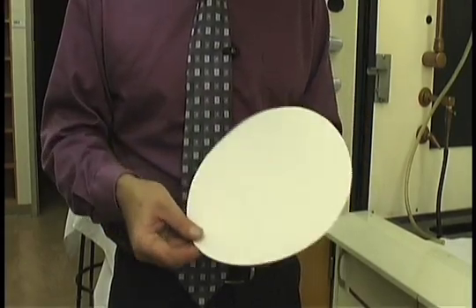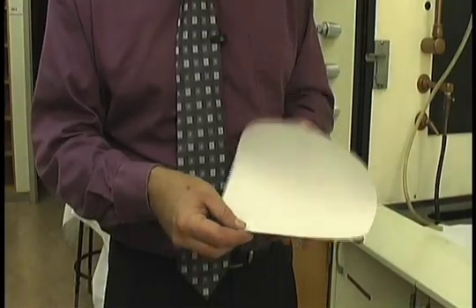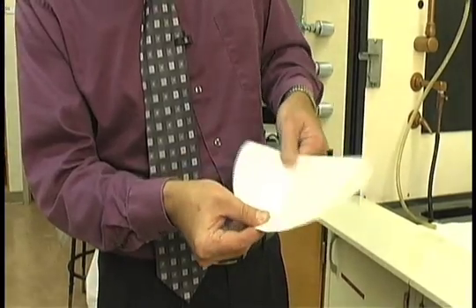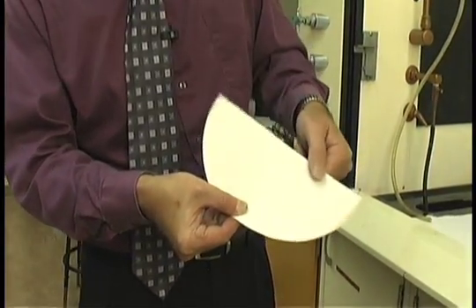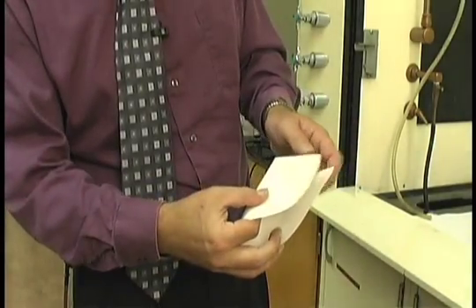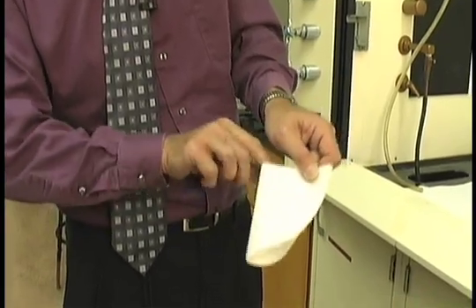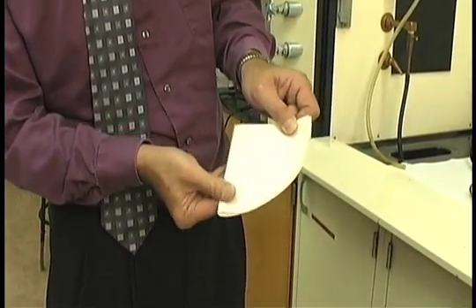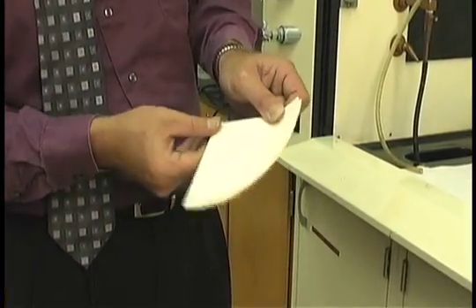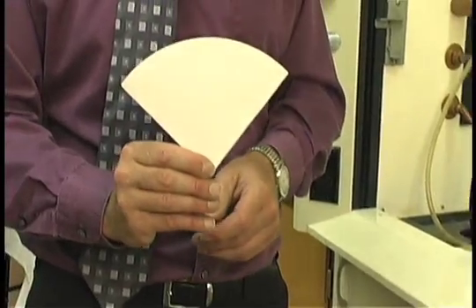To fold a fluted filter paper, first take your filter paper and fold it in half, and then fold the filter paper in half once more in the other direction, creasing the edges. You now should have a cone.